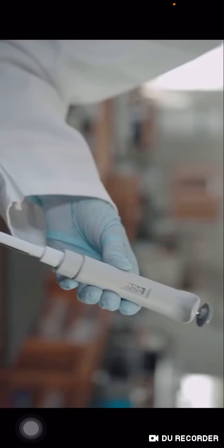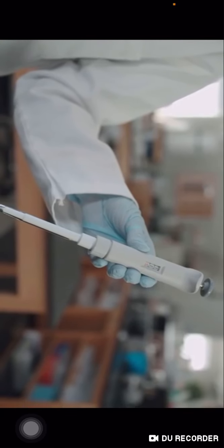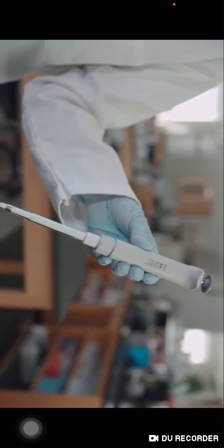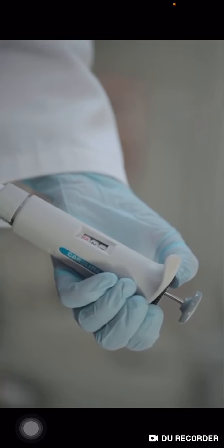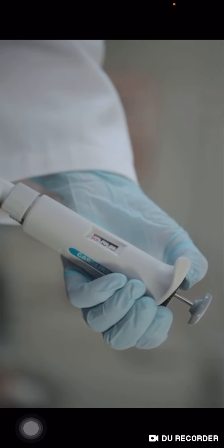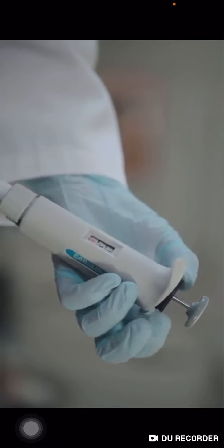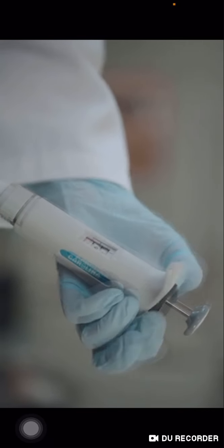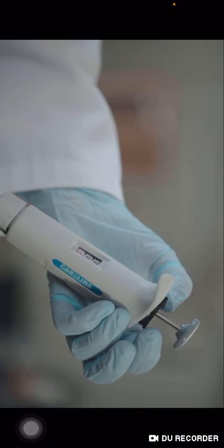For the P20, the top digit represents the tens place. The next digit down represents the ones place, and the digit at the bottom, in red, represents tenths. This micropipette is set up to take 12.5 microliters. We will use the P20 micropipette to demonstrate how to use a micropipette. However, the principles learned generally apply to other types of micropipettes as well.